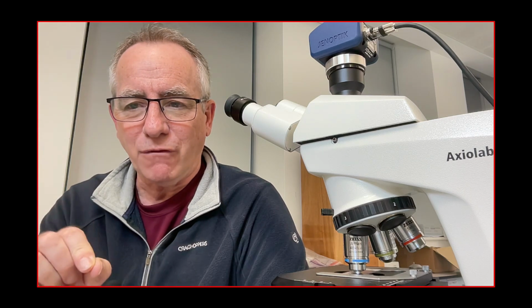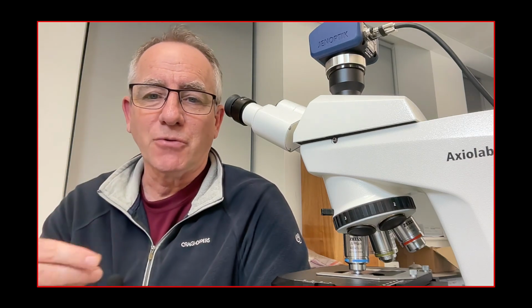And by looking through the microscope and recording what we were looking at on pieces of paper, we learned the anatomy of the structure we were looking at, to the point where I can still remember some of those early drawings today. And the fact that you observe and you try and make a reasonable representation of what you're seeing through the microscope on a piece of paper means that it sticks with you. It helps move the drawing, the anatomy, into your long-term memory.